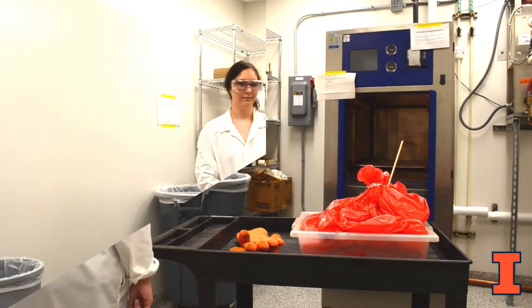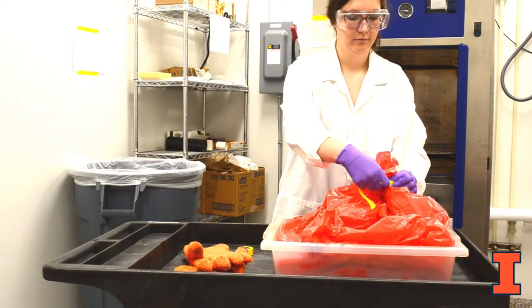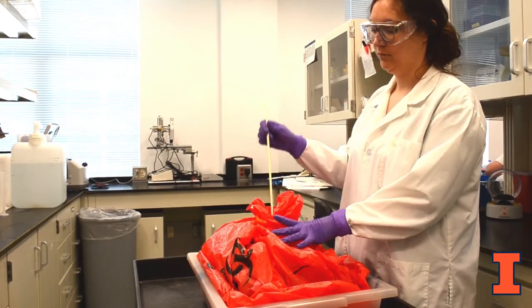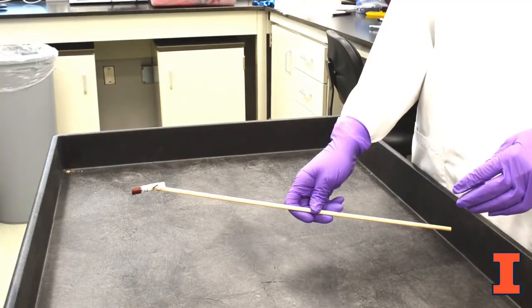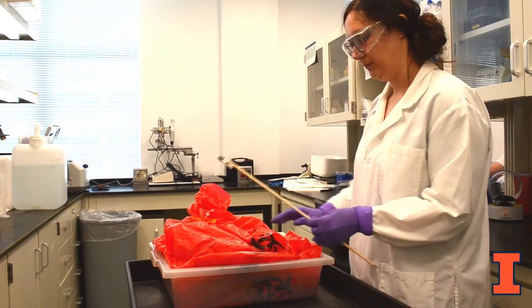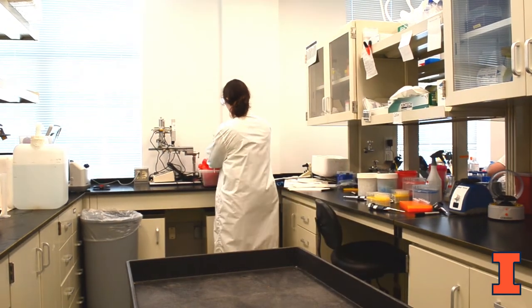Remove the waste and let it cool down. Don disposable gloves and reseal the autoclave bag. Remove PPE, wash hands, and transport all items back to your lab. Always wear PPE when handling the waste and treat the vial and the dowel in the biohazard bag as potentially infectious until test results indicate it has been effectively sterilized. Retrieve the spore vial from the bag and cool for at least 10 additional minutes since the vial was hot and pressurized. Decontaminate any surface that may have been in contact with the vial. Do not discard the autoclave bags until the validation test is complete and passed. Re-seal the autoclave waste bag and set aside to proceed with the validation test.